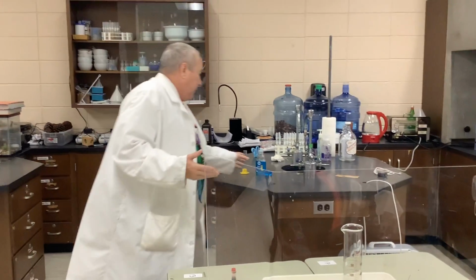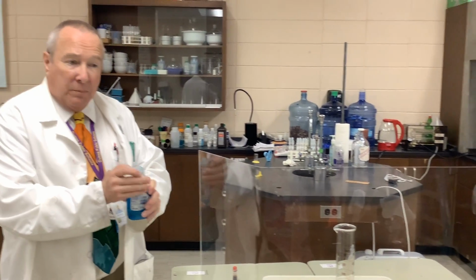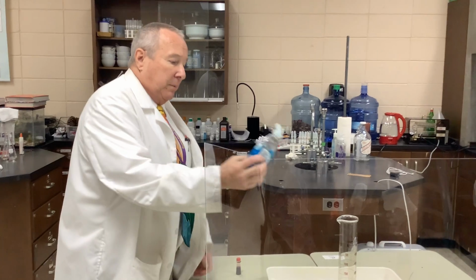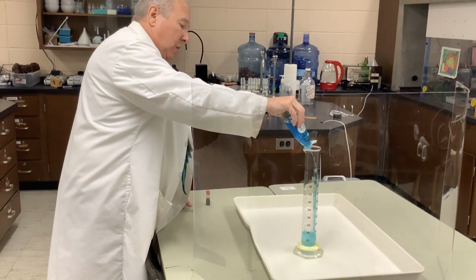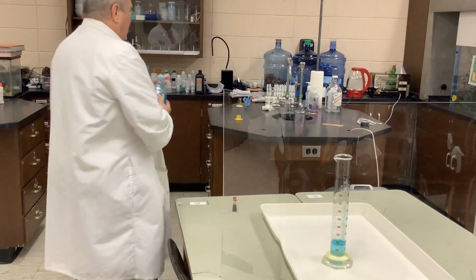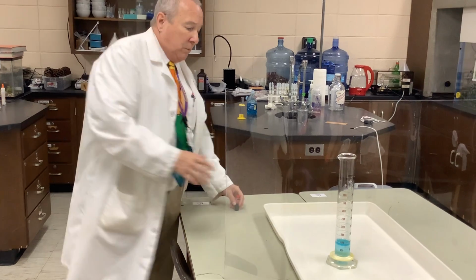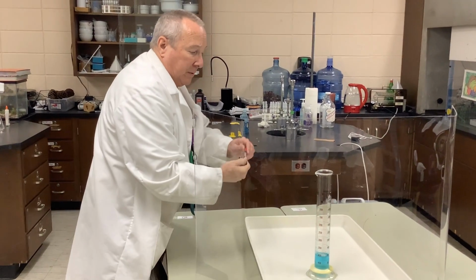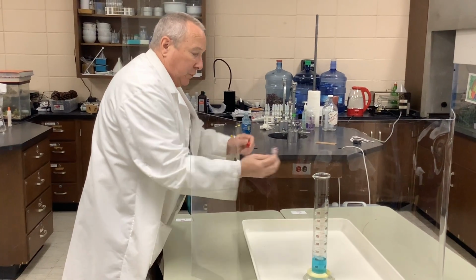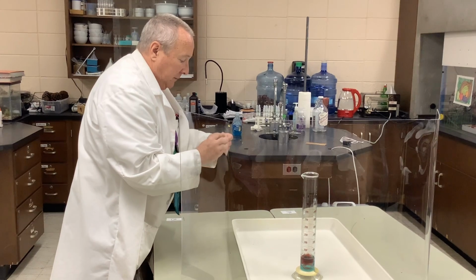And to make this demonstration a little more dramatic and more visible, so it's not just a bunch of bubbles, we're going to bubble into some foam, and I'm going to add about 10 mils of Dawn detergent. Mix that up, and to make the bubbles even more visible and more apparent, I'm going to add a few drops of red food coloring, just for effect.